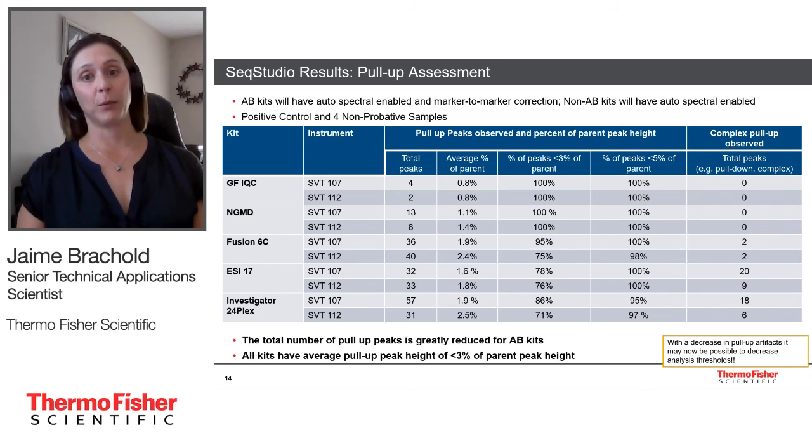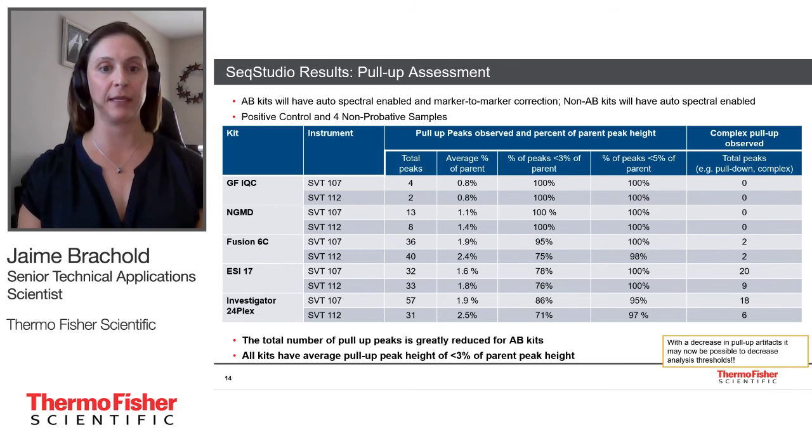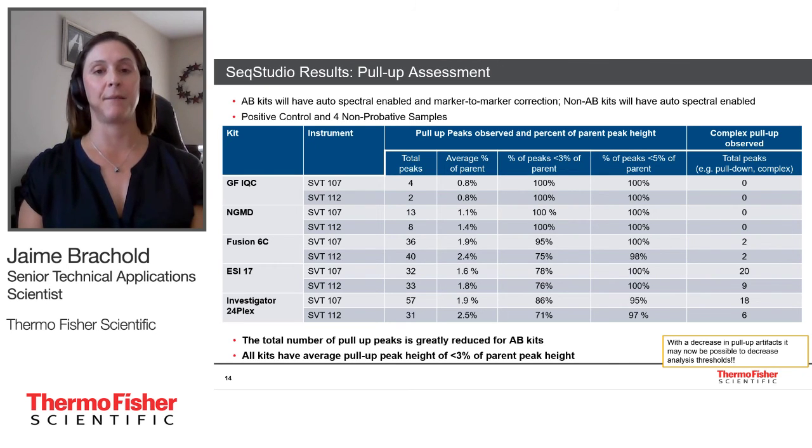So again, on the far right, you can see those complex pull-up peak counts. And then on the left, you can see the traditional pull-up counts as well as the percentages that were calculated. Again, all AB kits had an average pull-up percentage of less than 3%. All of the non-AB kits in this case had pull-up greater than 3%, and a few had pull-up still greater than 5%.